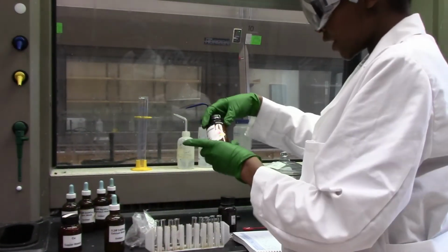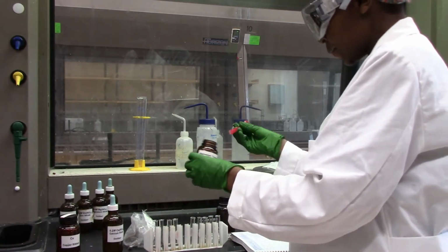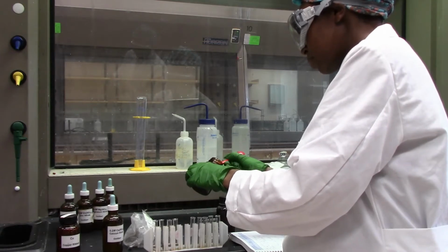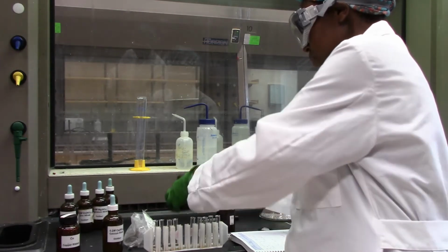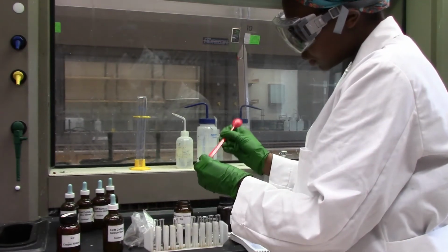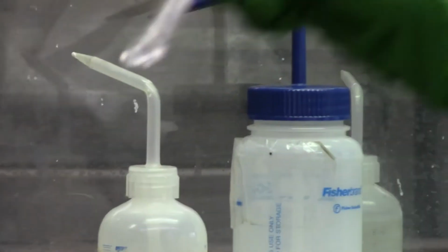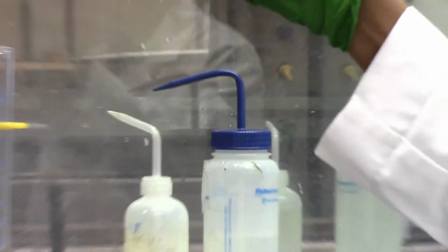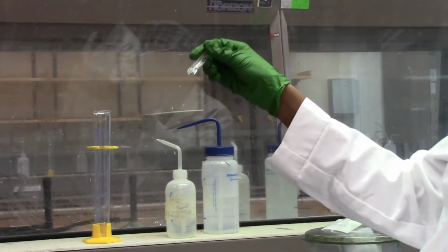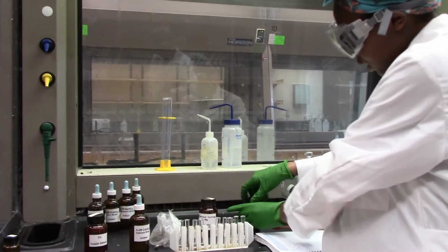We will go ahead and do the same thing for magnesium. Got these gray pieces here. Magnesium, same thing. Nothing's happening. All the solids just settled at the bottom. And lastly, we'll do zinc.